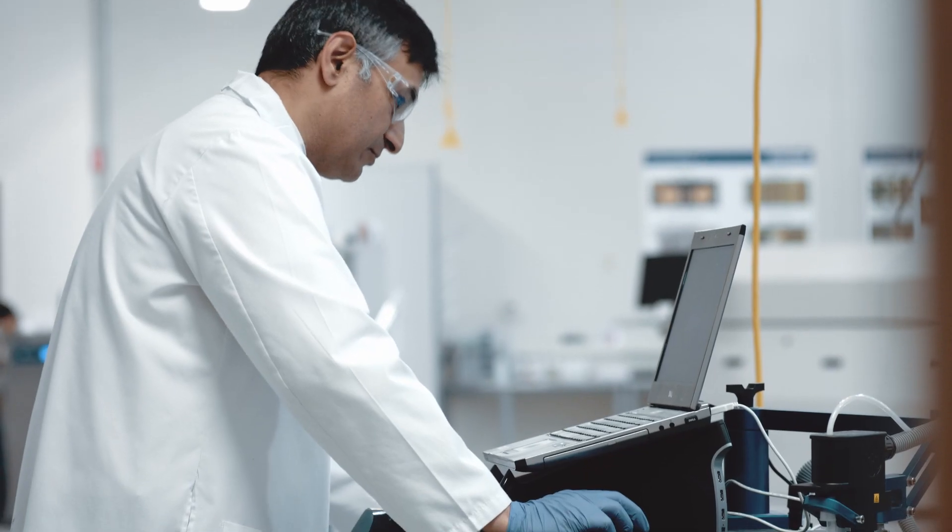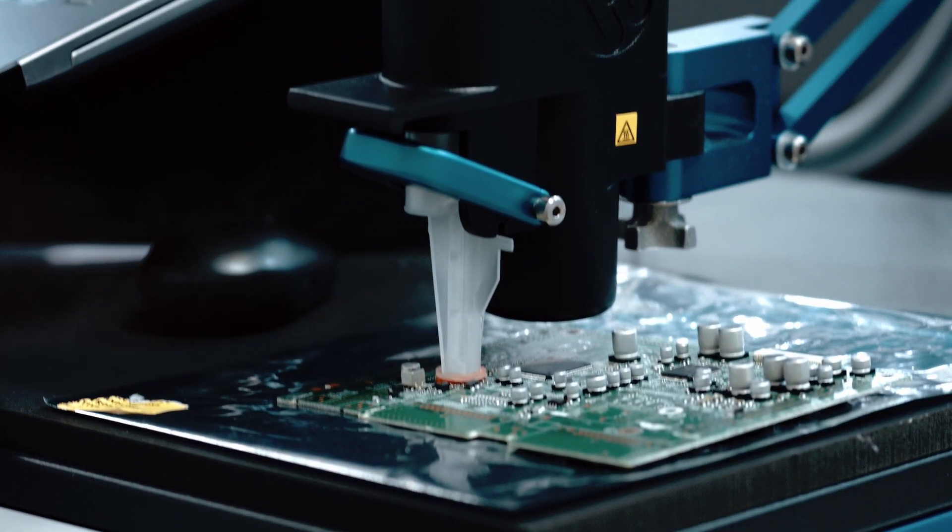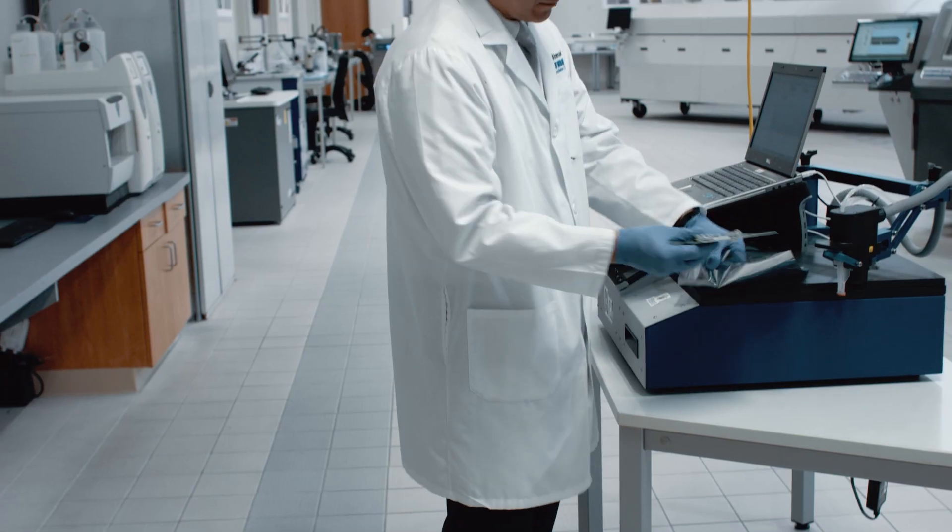Using localized extraction, we can efficiently and quickly access various individual areas on any circuit board assembly, bare boards, components or matrix to identify if corrosive residues are present. By identifying ionic residues and understanding troubled areas, we can help improve your product quality.